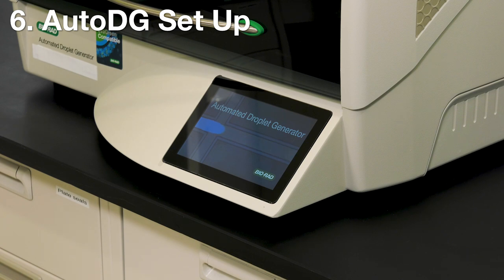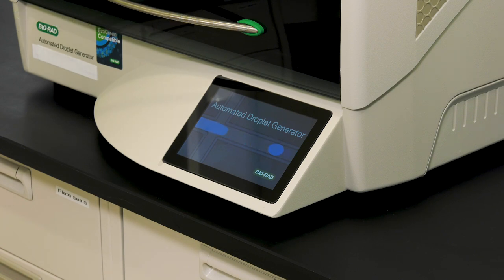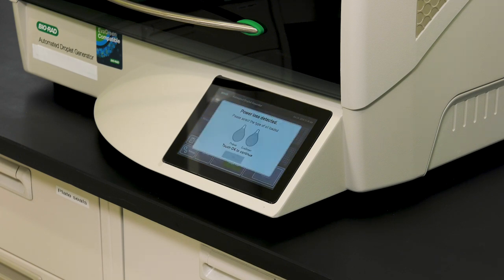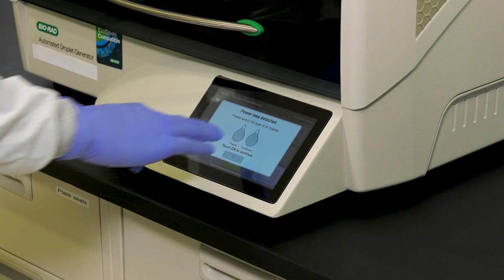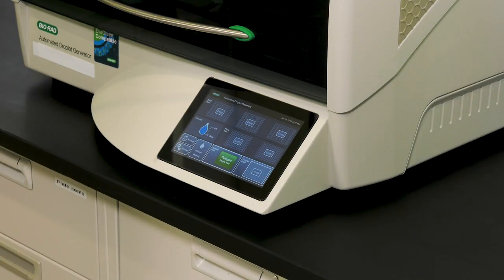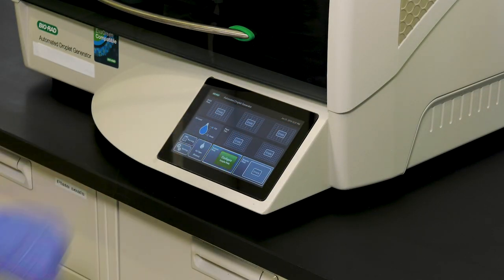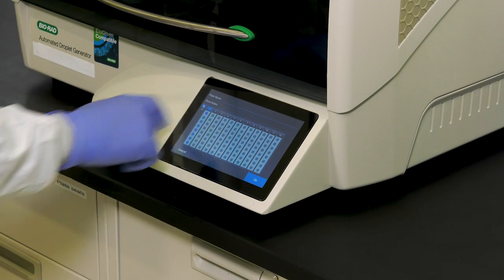Your DD-PCR 96 well plate is now ready to load into the automated droplet generator instrument for generating droplets. To begin, power up the instrument.